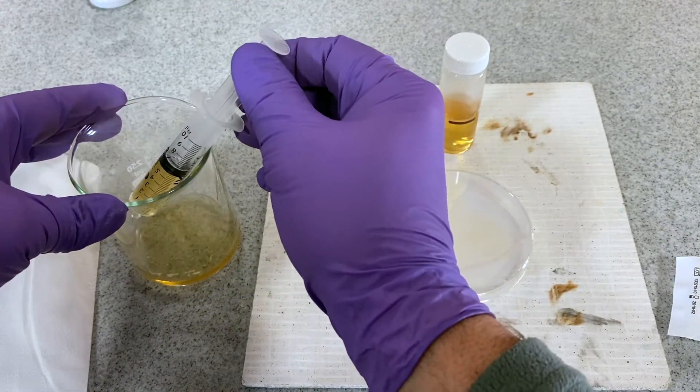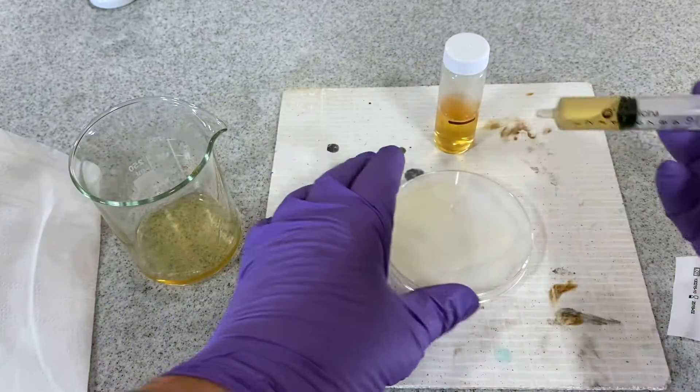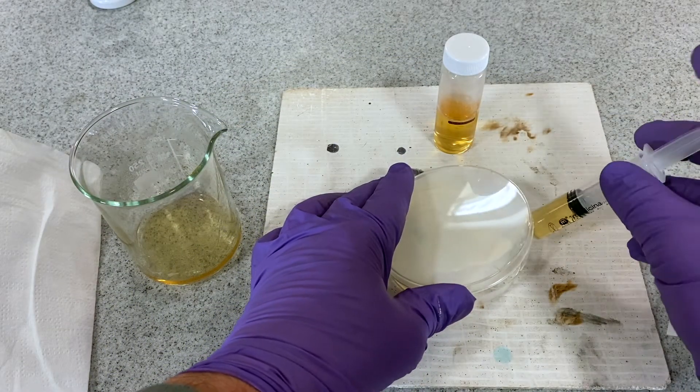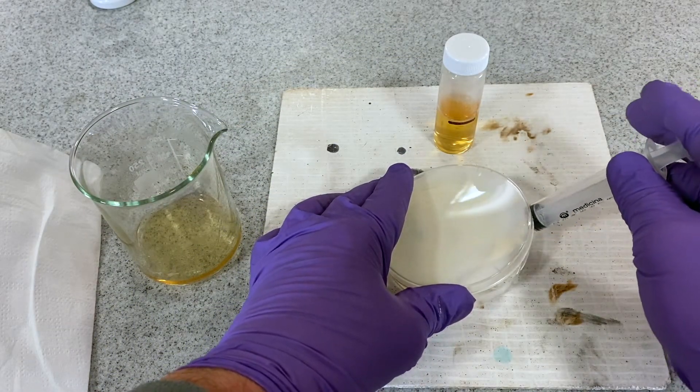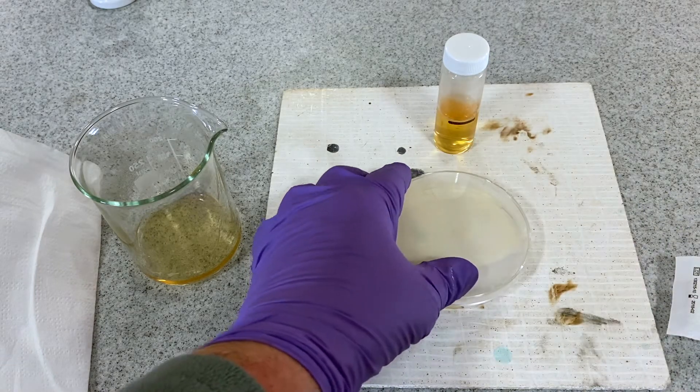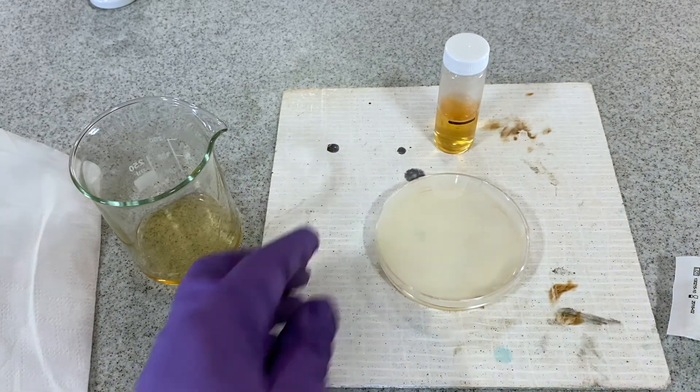Close it back over to add a further 5ml of agar medium to the plate. 15ml is an ideal volume in a petri dish of standard size.